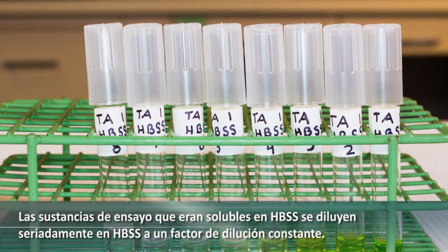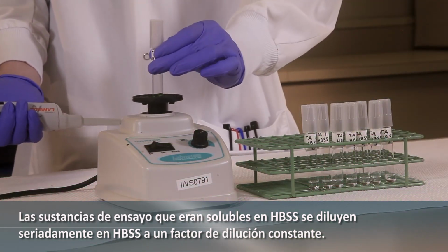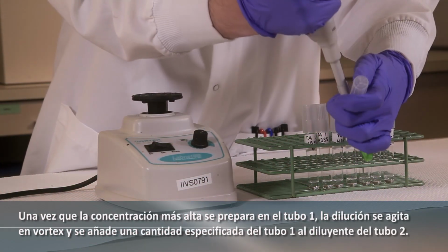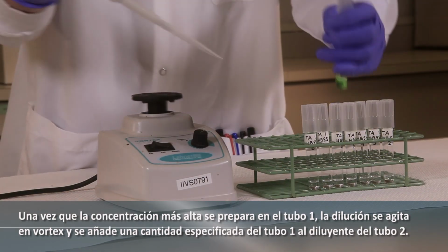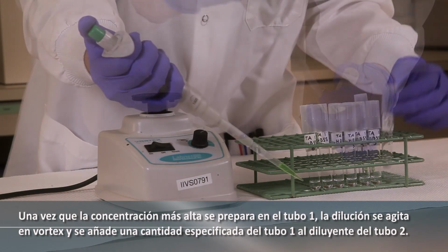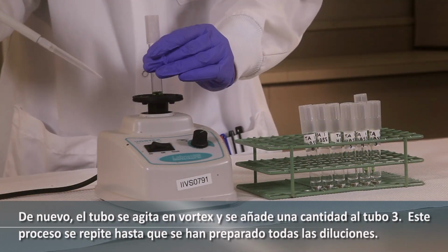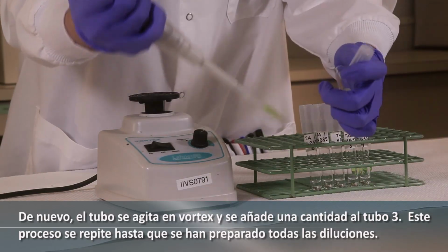Test substances that were soluble in HBSS are serially diluted in HBSS at a constant dilution factor. Once the highest concentration is prepared in tube 1, the dilution is vortexed, and a specified amount from tube 1 is added to the solvent in tube 2. Again, the tube is vortexed and a portion is added to tube 3. This process is repeated until all dilutions have been prepared.